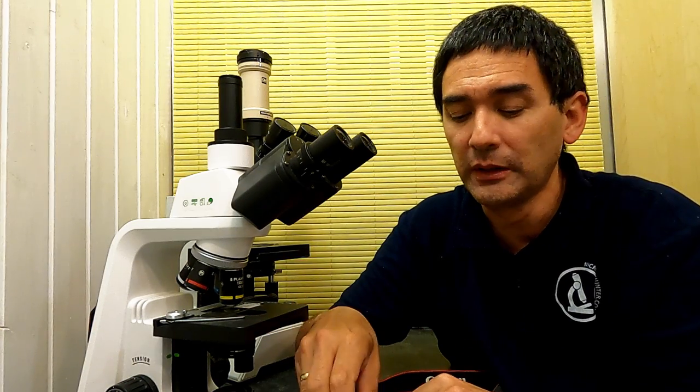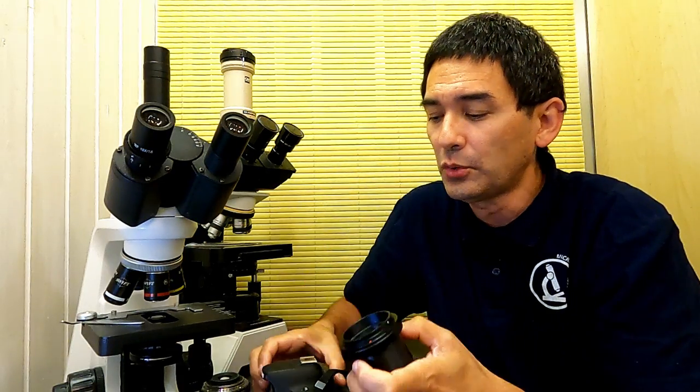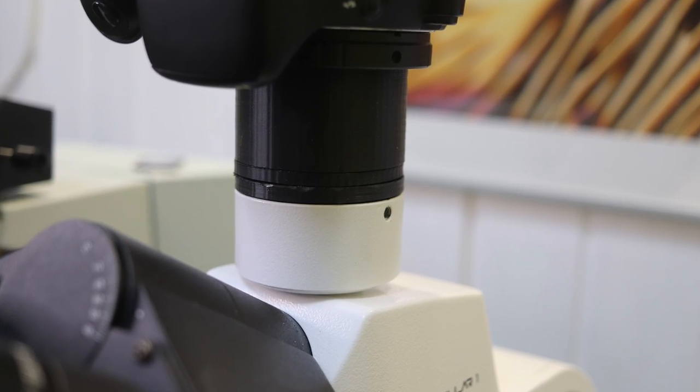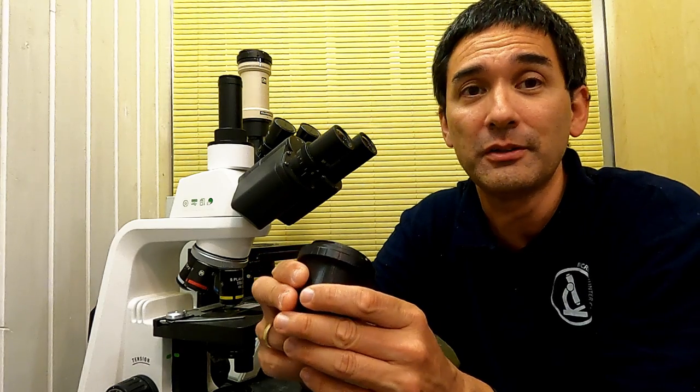And I also do not really understand the function of the diaphragm in the adapter, because even when you close it, it does not really reduce much of the reflections. The thing that I do not fully understand is why microscope manufacturers don't simply make something like what I've made, which is simply an empty tube. This is a tube, no optics, and you can also connect the camera here. Then it can go up here. You remove the complete photo tube and you can put it in here, and you also get a picture, and as a matter of fact, of pretty decent quality. They don't seem to do that, and I don't know why. I just wanted to make it clear there are easy solutions around, which for whatever reason are not very common. I think I'm just going to leave it at that.